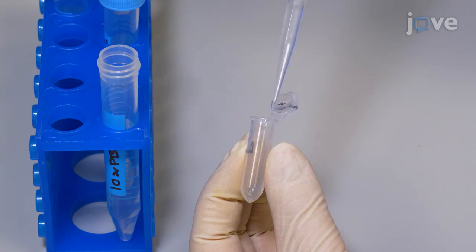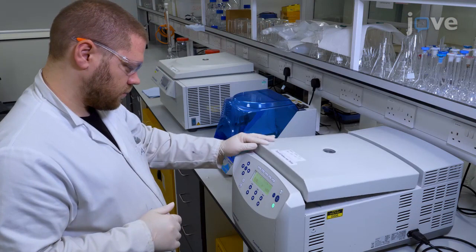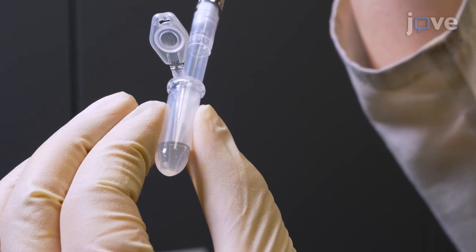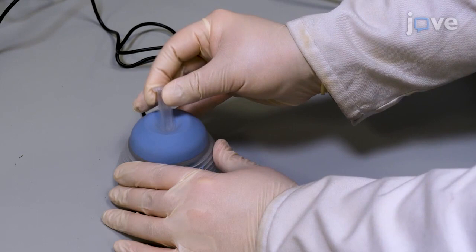Re-suspend the pellet in one milliliter of 10x PBS buffer and vortex vigorously for two minutes to remove unbound proteins. Centrifuge the solution at 4000 times G for 15 minutes at 4 degrees Celsius to pellet the nanomaterials, then remove the supernatant carefully without disturbing the pellet. Re-suspend the pellet in one milliliter of ABC buffer and vortex vigorously for two minutes to remove unbound proteins and unbound salts.